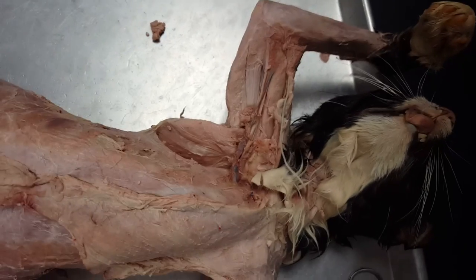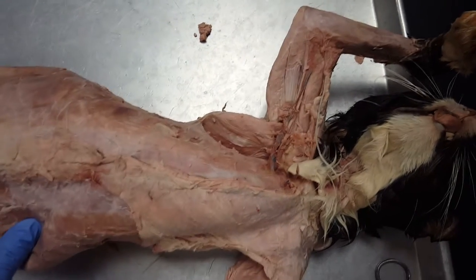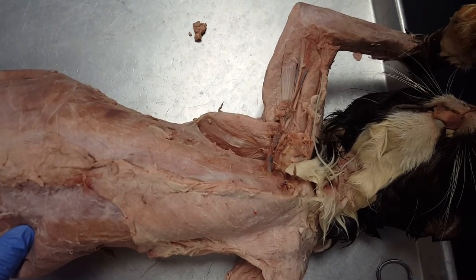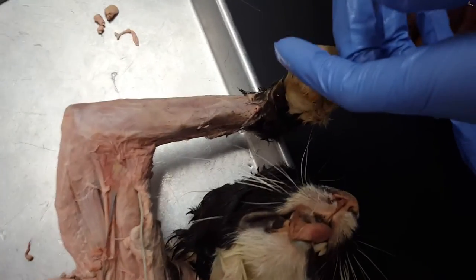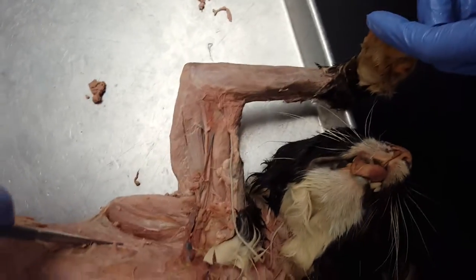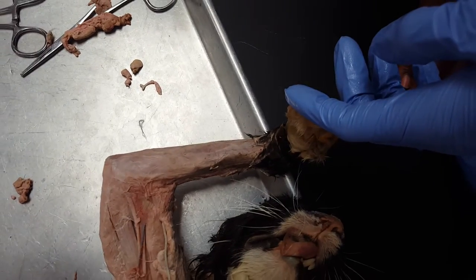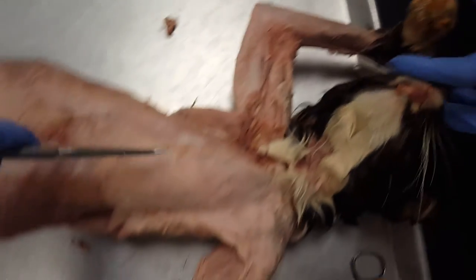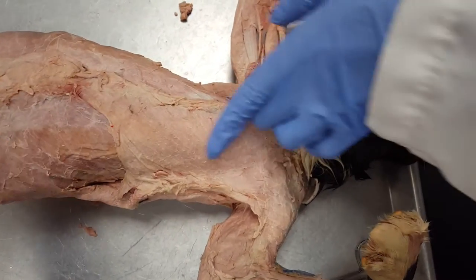The deltoid group and trapezius group — she said deltoid group and trapezius group, we need to know all of those. This is linea alba.